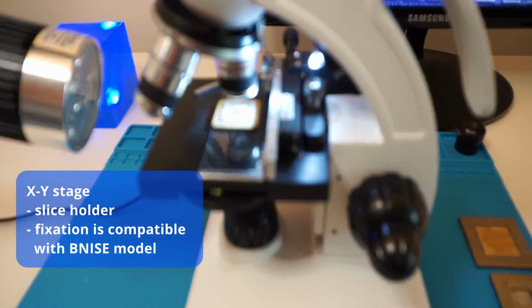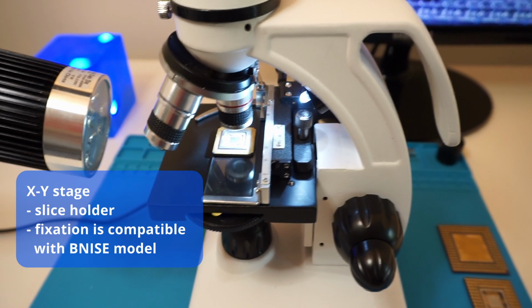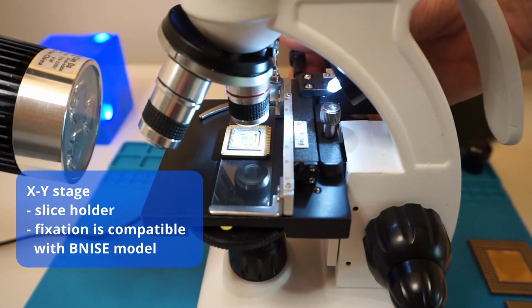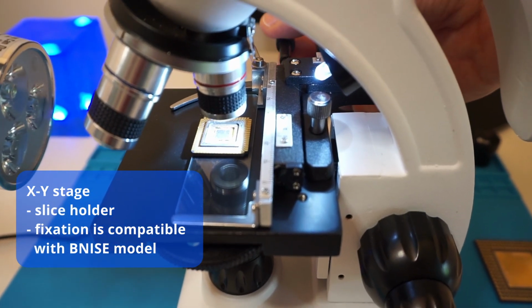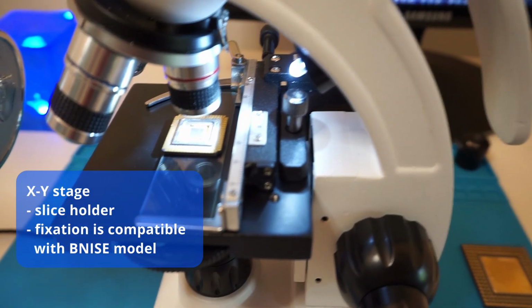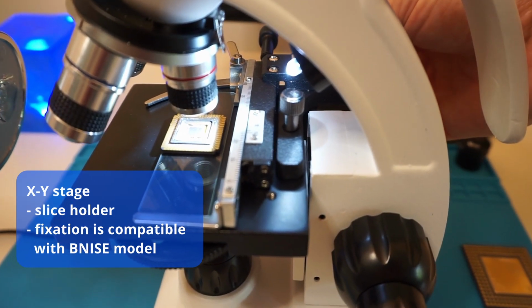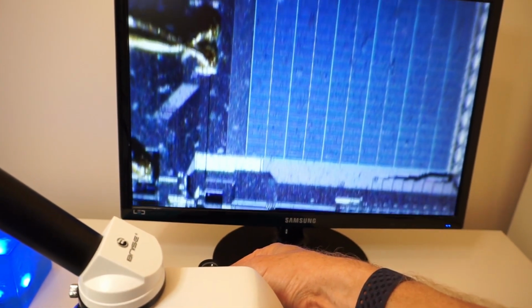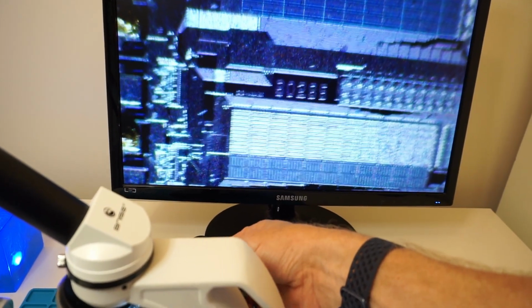The last point which I mentioned was the navigating part. Here you see I have bought a very cheap, so I was super surprised, a very cheap objective table device. So you see I'm moving with a screw here directly to the part I want to see. The picture also changes, so you can really do it in a very slow fashion. You have to get used to it a little bit.